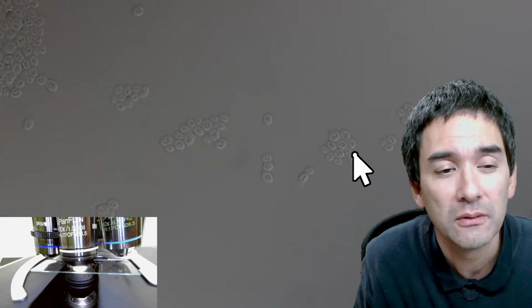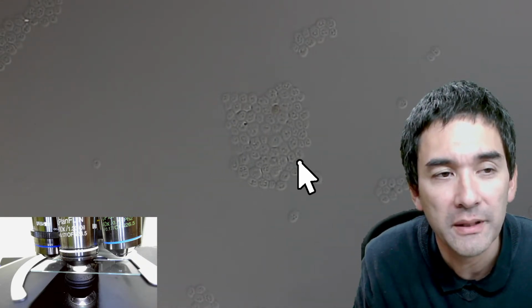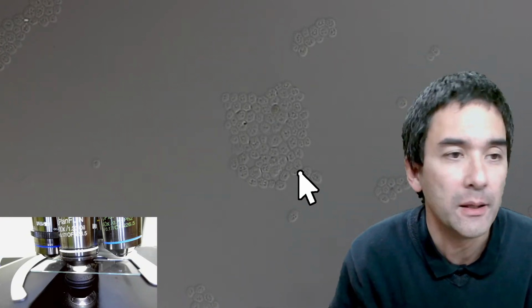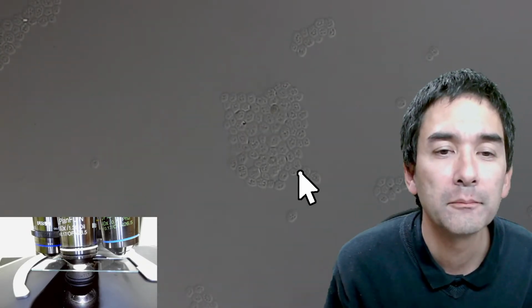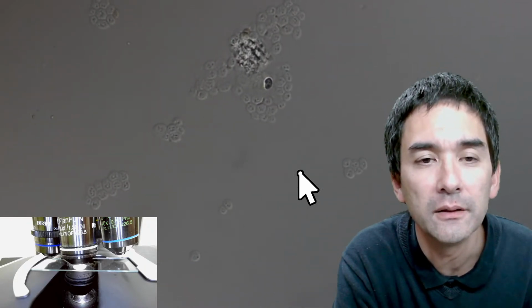And this basically means that they might appear different than when they're simply in water, and they do look different. Okay. However, this is the only way that you can sometimes use without them being flushed away when you stain them. Okay, but I think honestly, the previous one looked a little bit more contrasty, looked a little bit better. Well, maybe let me close the thing a little bit more here. Yeah, so that is basically simply a process of heat fixing, but honestly, I think the contrast is not quite as good as the other one.